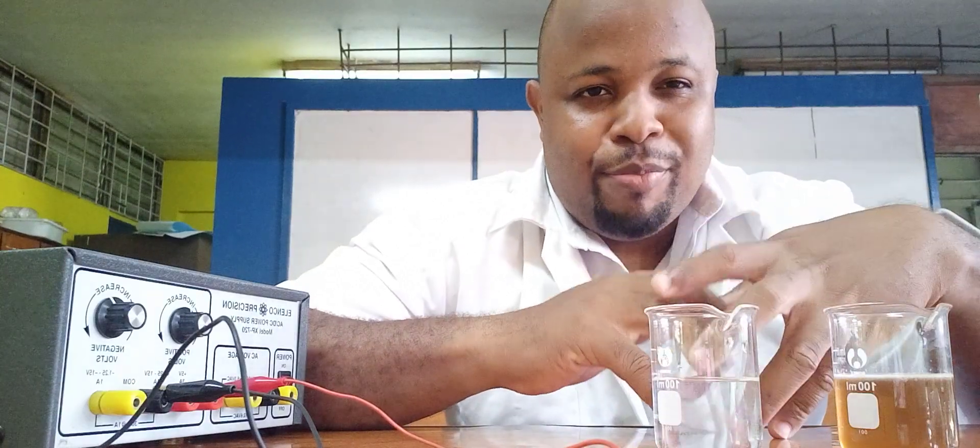Welcome back again to another video. In this video, we are doing an experiment to determine whether certain substances are electrolytes or not.